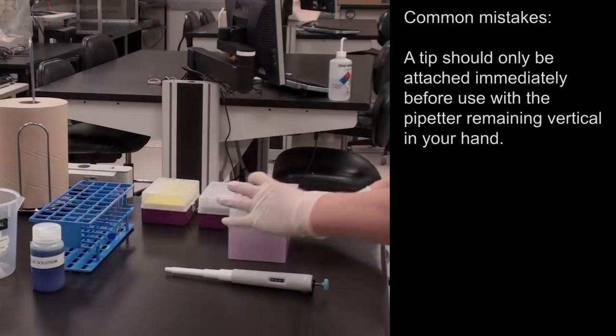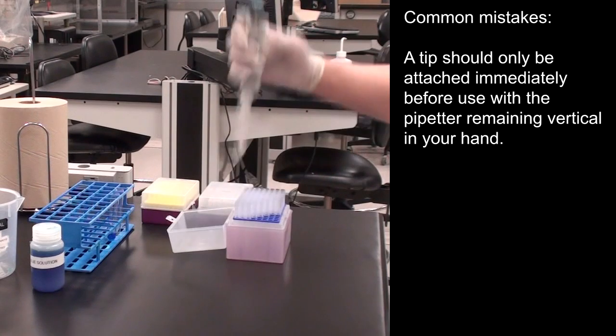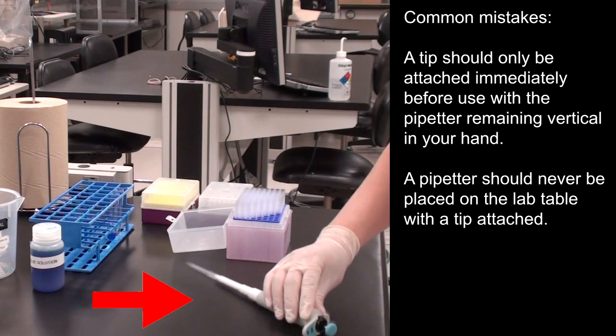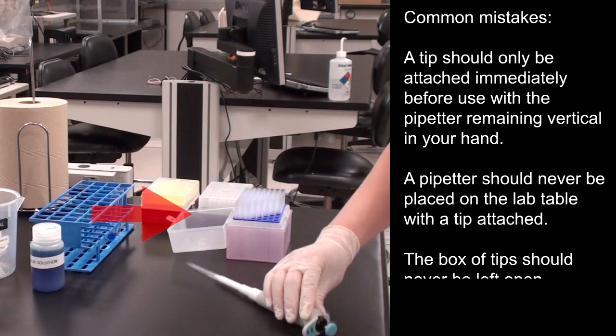A tip should only be attached immediately before use with the pipetter remaining vertical in your hand. A pipetter should never be placed on the lab table with the tip attached. A box of tips should also never be left open.